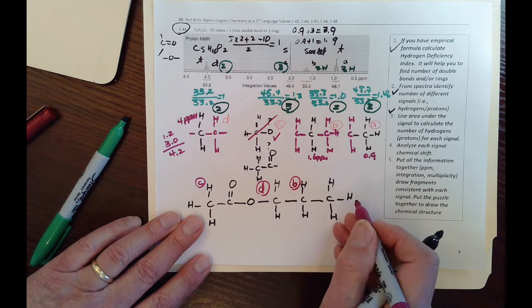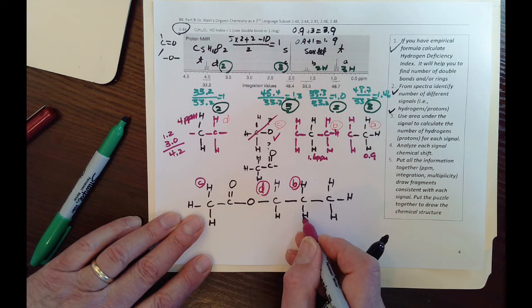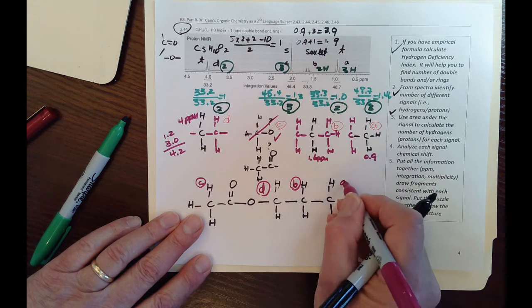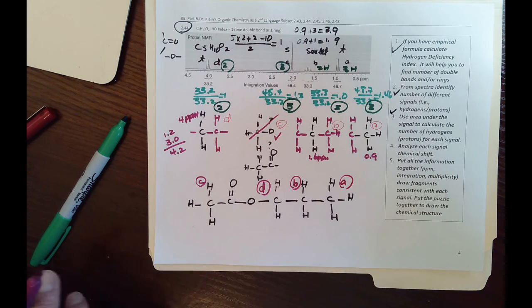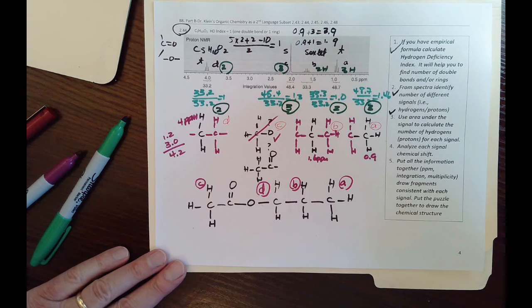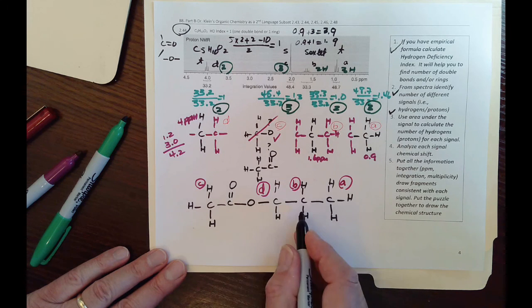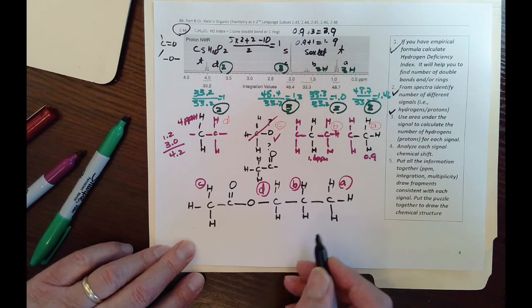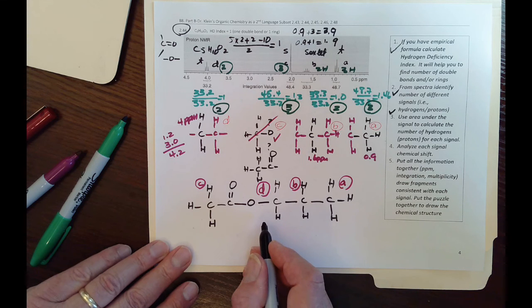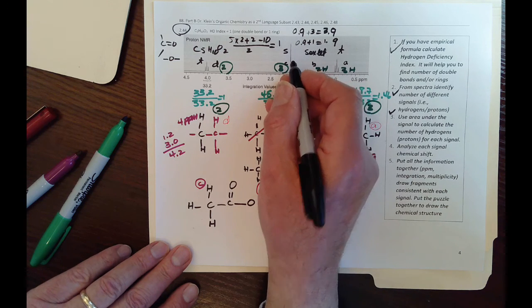Then we have the last CH3, which is next to the CH2. So that's a triplet. That should be A. Look at that. So that's the structure for this ester and its corresponding NMR. So this is CH3, CO, O, CH2, CH2, CH3. Then we're going to go backward in a second to look at going from the structure to figure out if we can make this a spectrum or not.